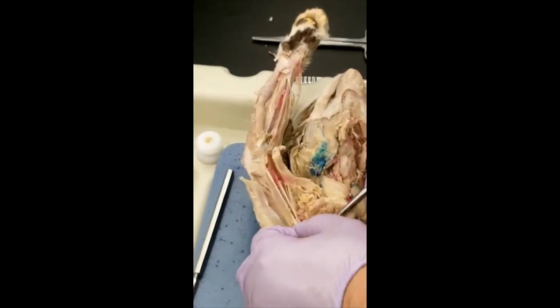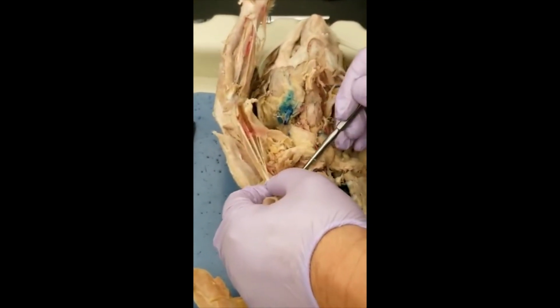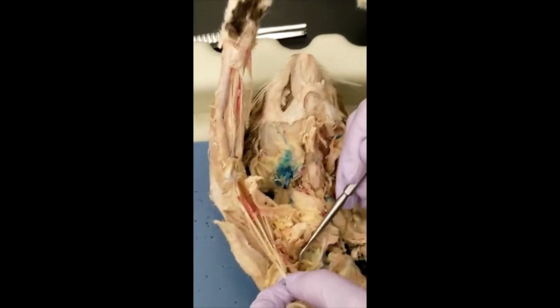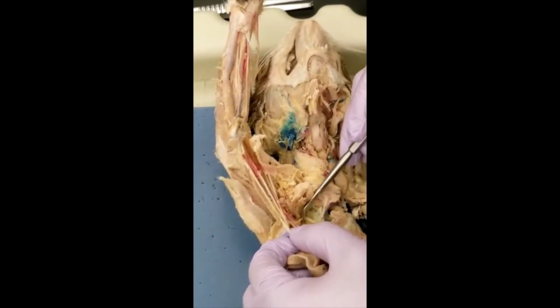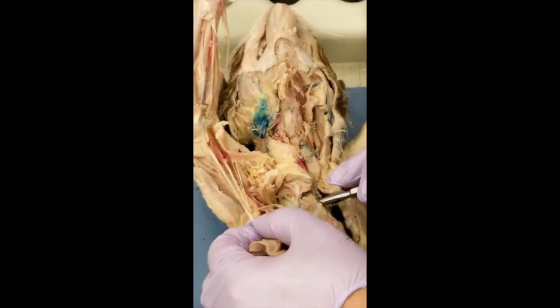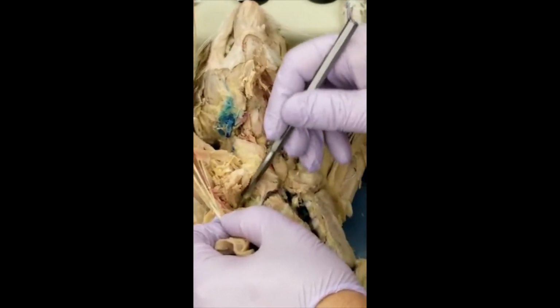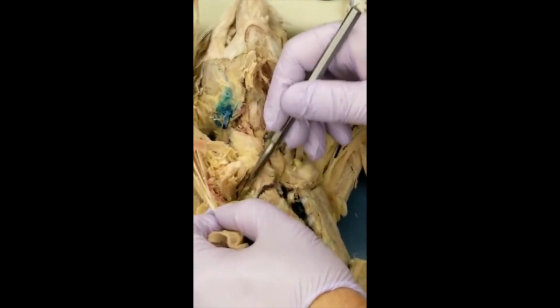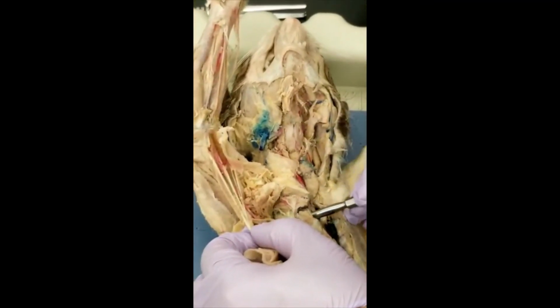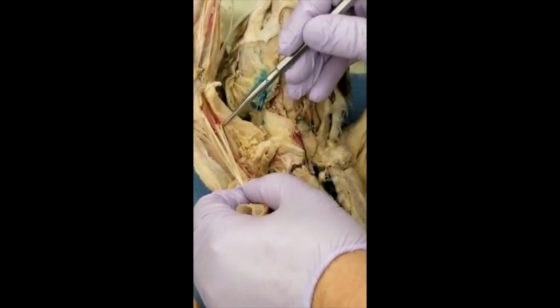And over here, the axillary has a major branch supplying the scapula. We call it the subscapular. Is this one? This one, supplying the scapula. You can pinch it down so that you make sure this is the scapula, and you also see this subscapular vein over there, side by side.